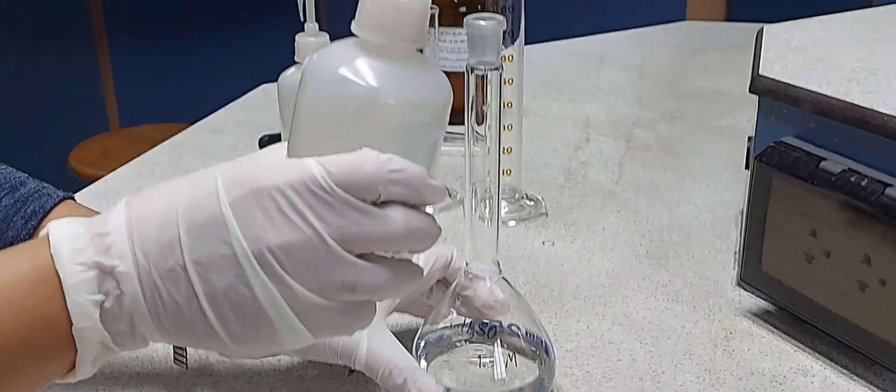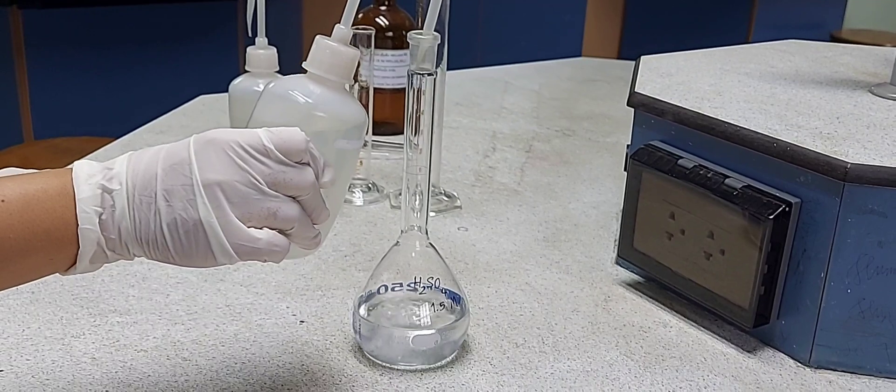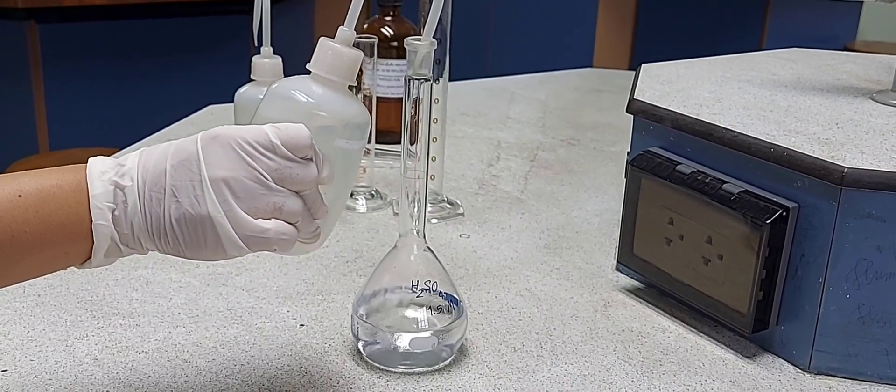Then what we do is we are going to make up the solution to the 250 ml mark on the graduated flask.